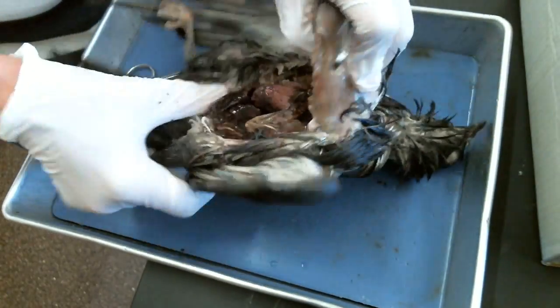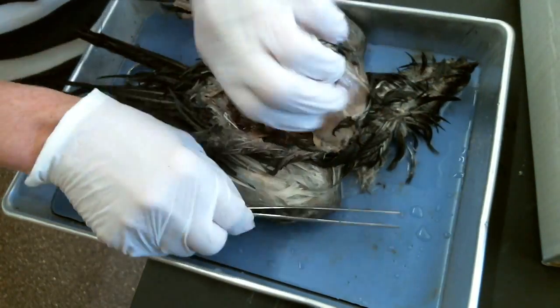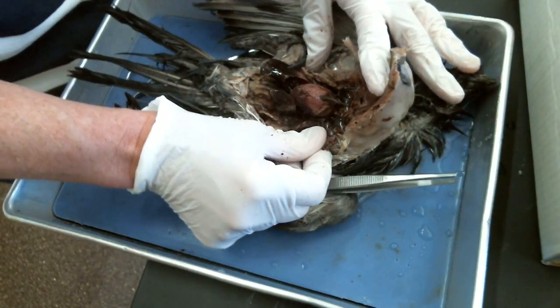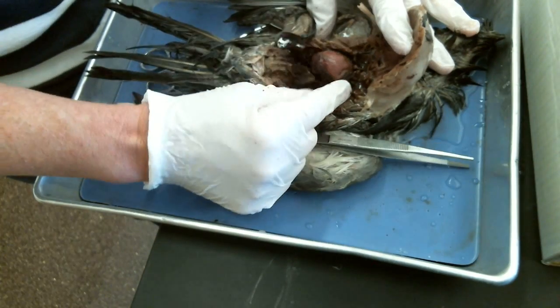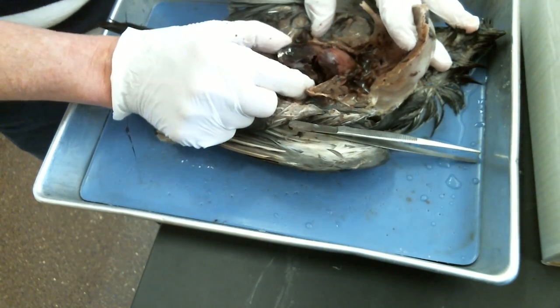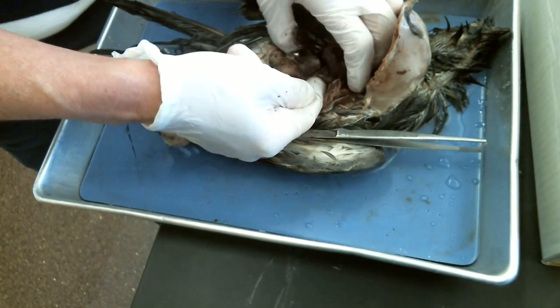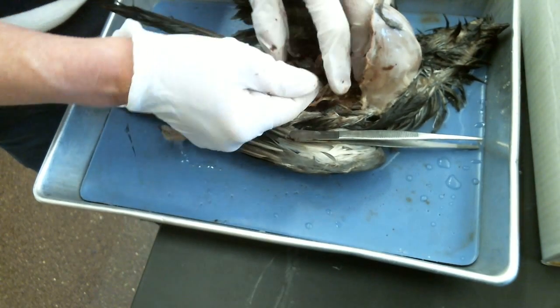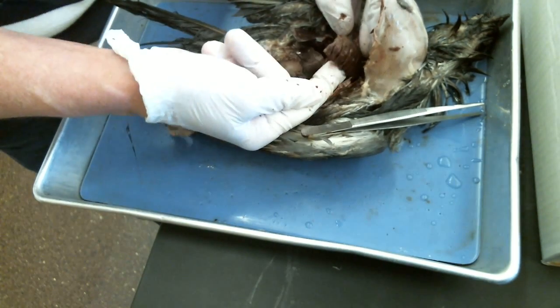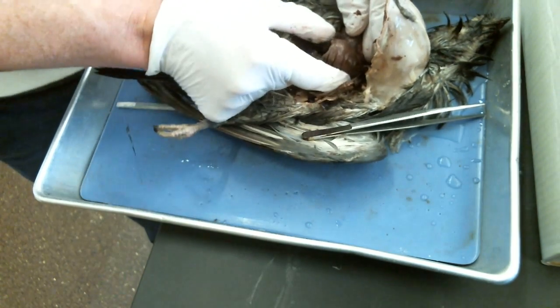I'm going to turn it over and get some of that fluid out of the way. Now that he's open, you can see some structures inside here. The first obvious big thing is the heart — remember these birds have a four-chamber heart, so we've got a nice big heart here. This large structure is the liver. Anytime you open that abdominal cavity, the biggest thing you're going to see is the liver. One of the harder things to see will be the lungs. I'm going to take my finger and go right by that rib cage and wiggle this up — this is a big lung.